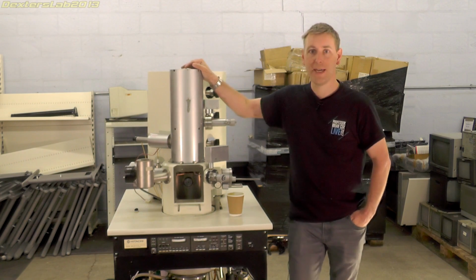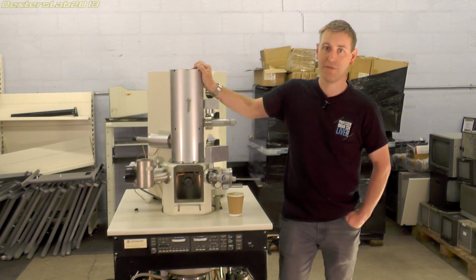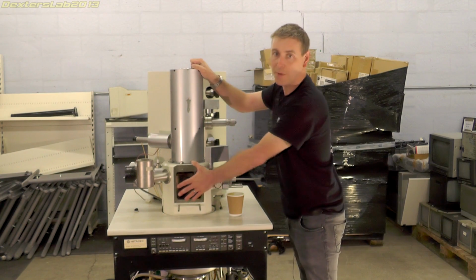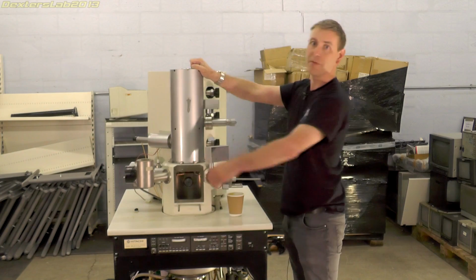So this part here is called the main console. It's the actual science element of it, but it too is missing components, at least the specimen table with the hand controls to move the specimen around inside the chamber.